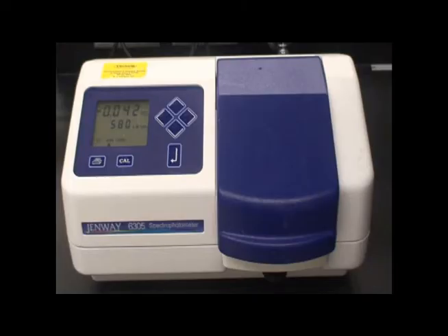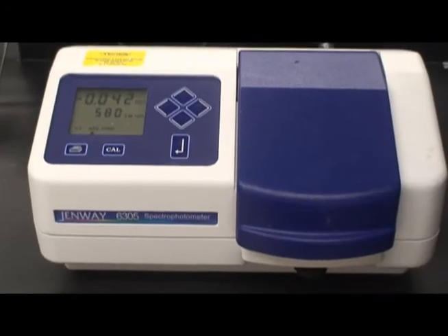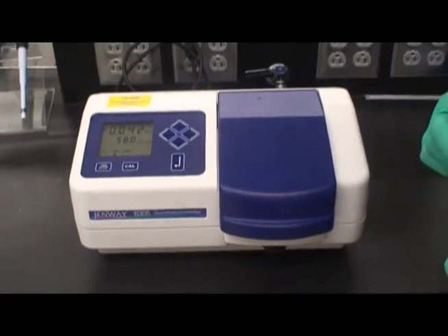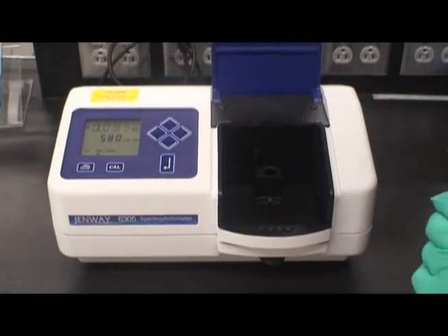Prior to taking sample readings, the spectrophotometer must be calibrated. In some cases, a cuvette filled with sterile water, or a blank cuvette, can be used.